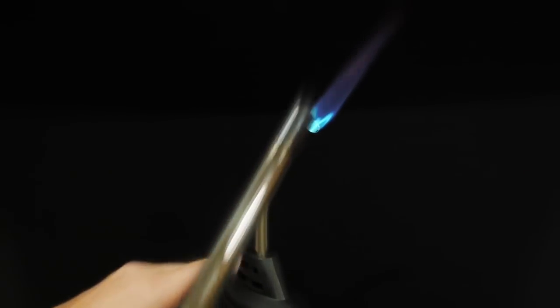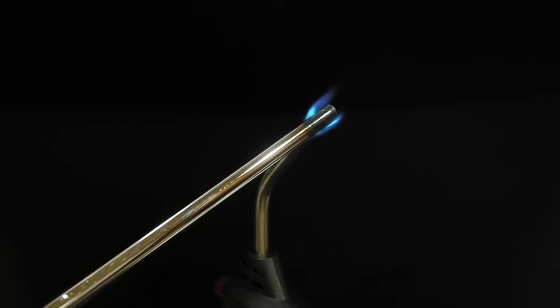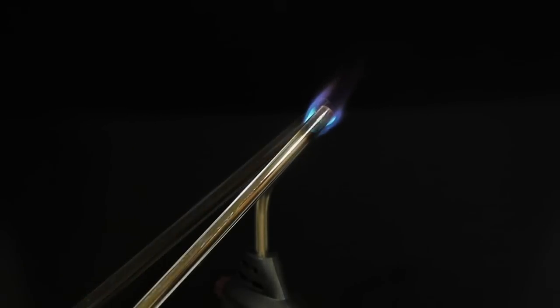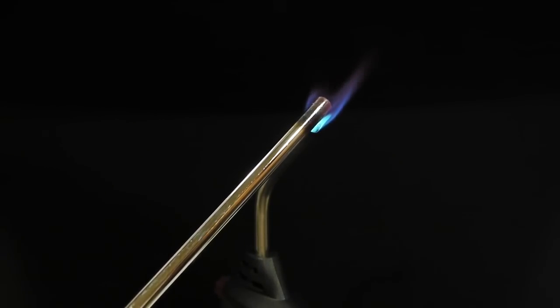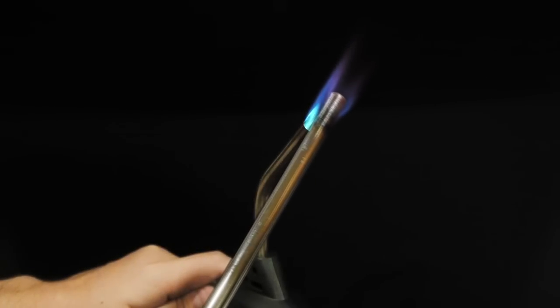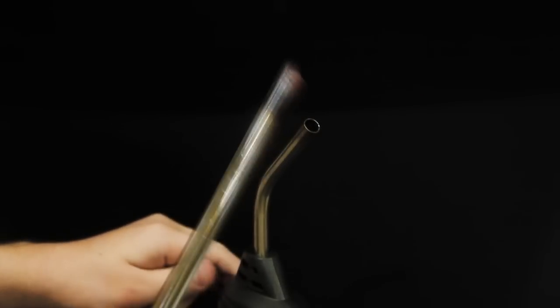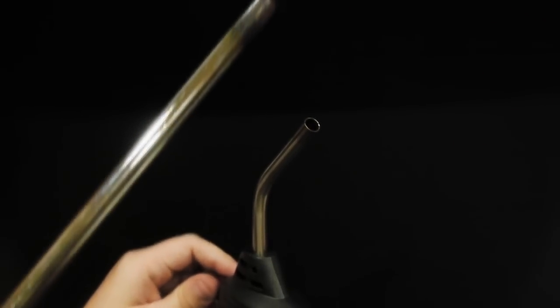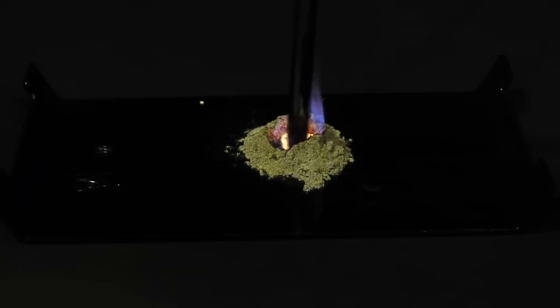We're going to heat up that rod until it's nice and red. Now this is going to take a while, so again, I'm going to speed it up. I'm going to take a little bit off. In reality, this took probably about 3 minutes. But as you can see here, with the magic of time lapse film, we can get there in just under 30 seconds. The rod's nice and hot. Let's plunge it in. I'm going to take that rod and plunge it into the magnificent powder that I've created. And let's see what happens.